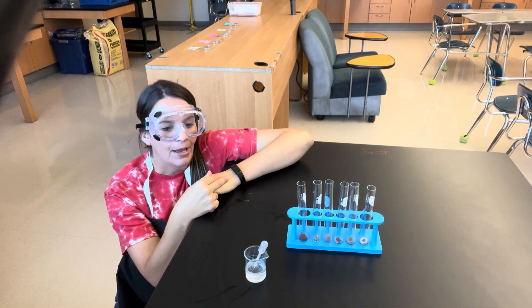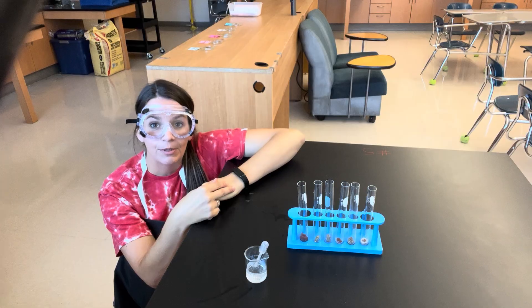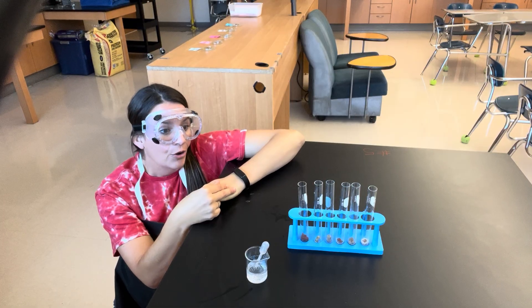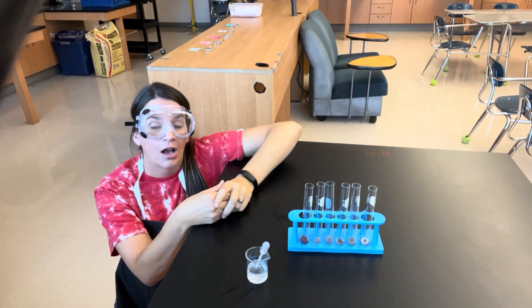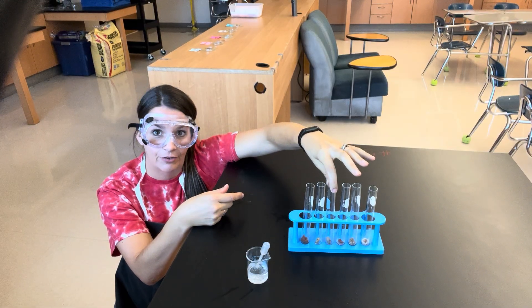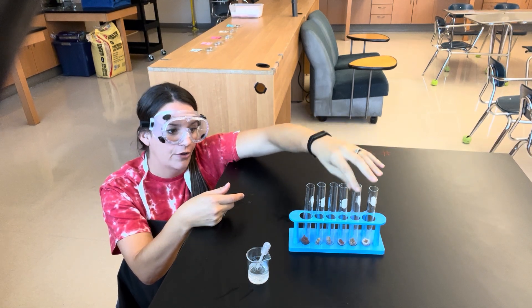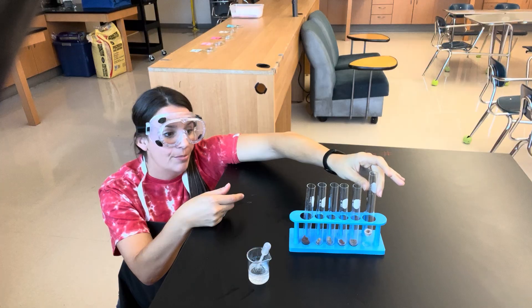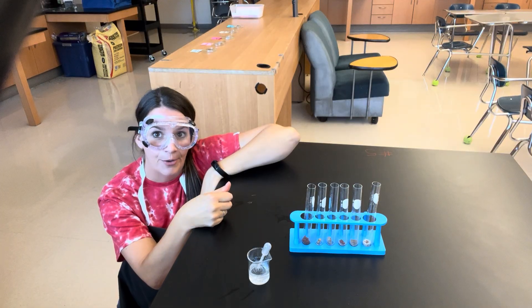During today's lab, I'm going to be exposing different types of liver to hydrogen peroxide, and we're going to be rating the reaction rate — so how many bubbles are produced as a gas is given off. We'll start with raw liver. We also have potato, because different tissues of different plants and animals also have the catalase enzyme. Then we have cooked liver, which has been exposed to an extreme temperature; frozen liver, exposed to extreme cold; and liver soaked in acid and liver soaked in base. Both of those will show us what different pH levels do to the enzymes in liver as well. So let's get started.